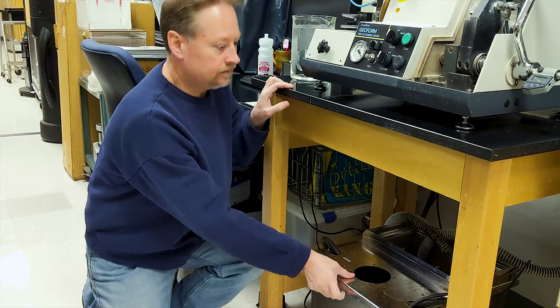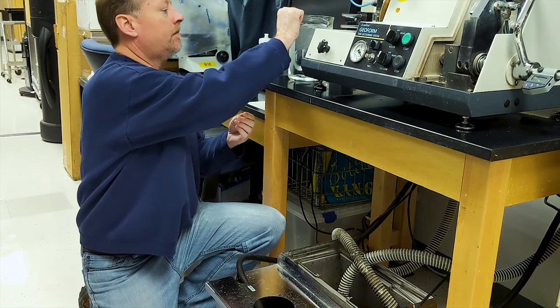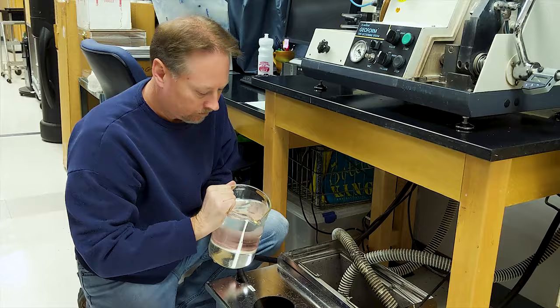When the saw is in operation, water is delivered and recycled as a coolant via a pair of pumps from the recirculating water tank stored beneath the GeoForm.